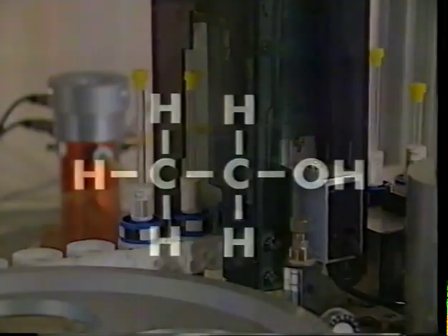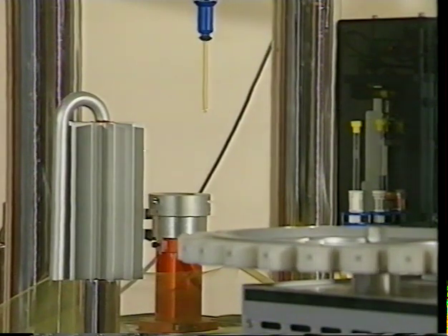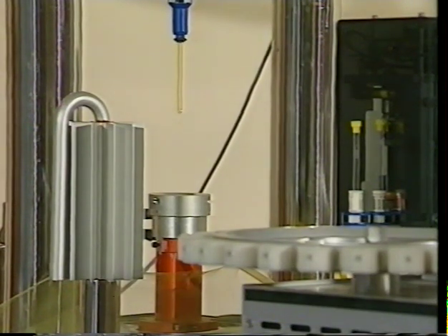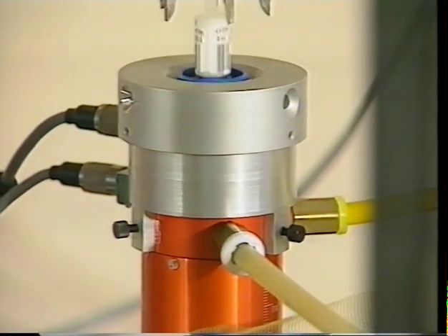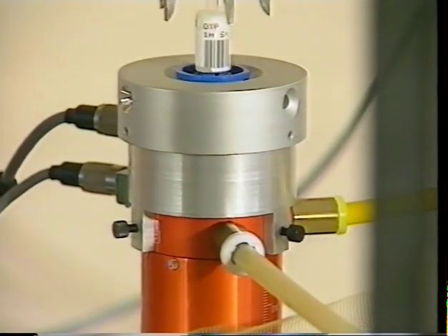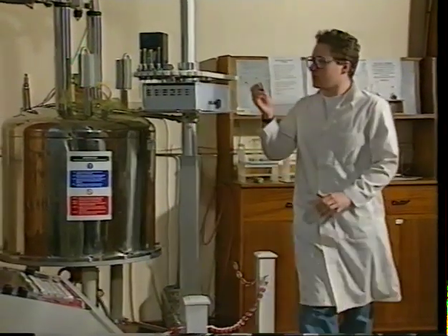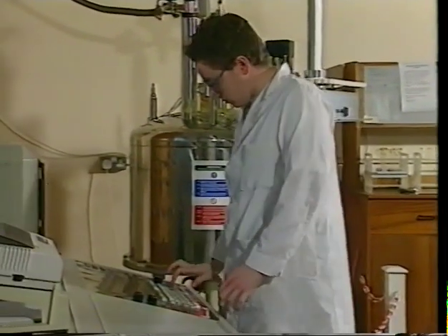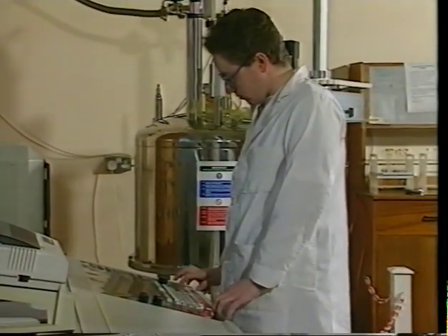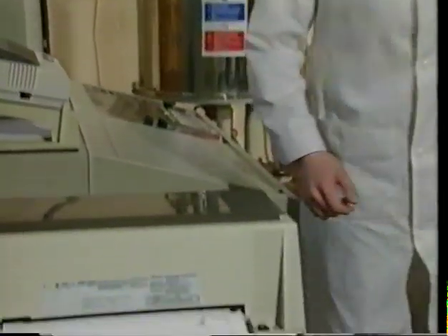Because the various protons in a molecule require different energies to resonate, the spectrometer sweeps across a whole range of frequencies, recording the absorption at each frequency, and displaying this as a series of peaks on a spectrum. So, in other words, a record of the different frequencies at which protons resonate in a given sample will give a clue to the various chemical environments of hydrogen atoms in the molecule, and so help us to determine its detailed chemical structure.